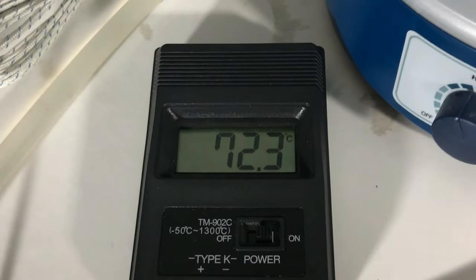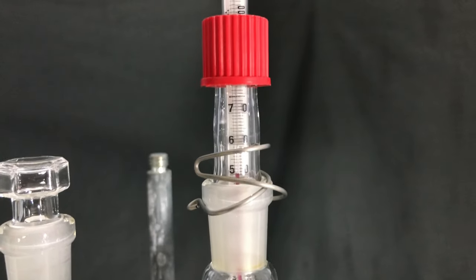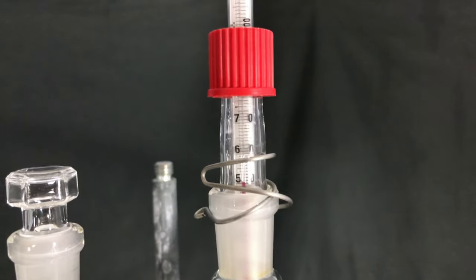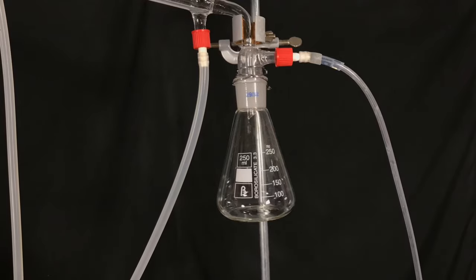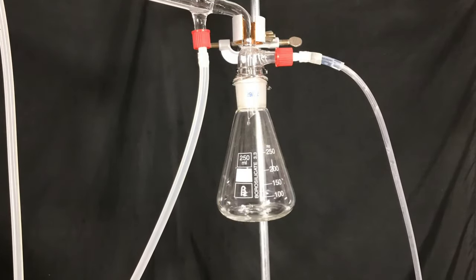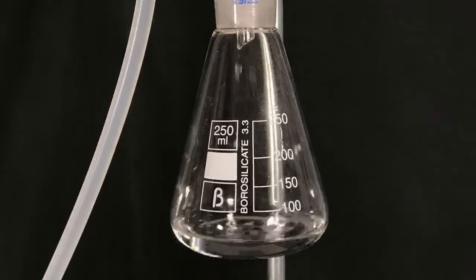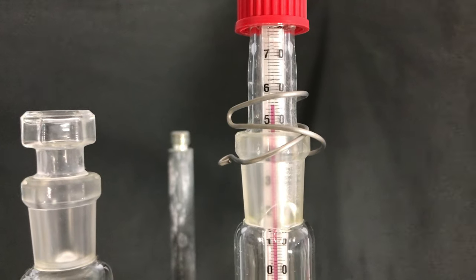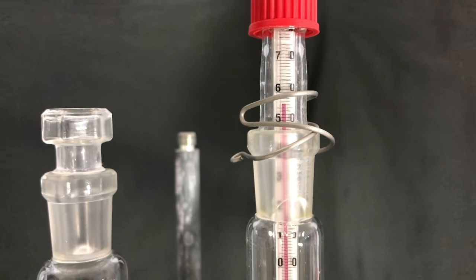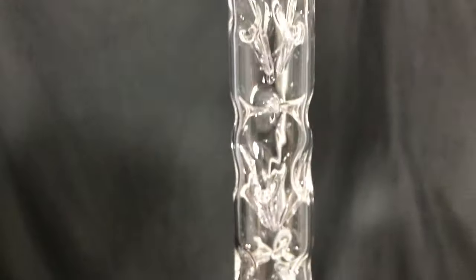Here you can see the temperature down in the boiling flask. Pure tri-methyl borate evaporates at around 68.7 degrees celsius, and you can see that we are around at 51 degrees celsius. Yet we are collecting a lot of product. How can that be? The reason for that is simple. We are not collecting pure tri-methyl borate. This stuff is an azeotrope consisting of 75% tri-methyl borate and 25% methanol. This azeotrope boils at 54 degrees celsius.